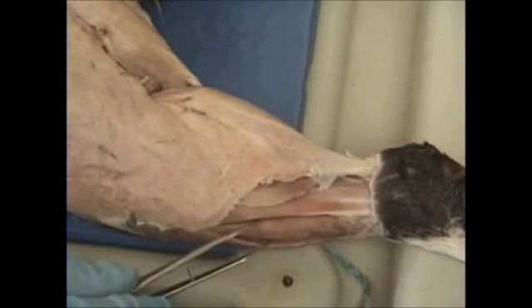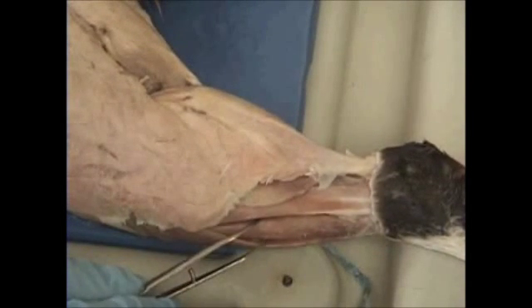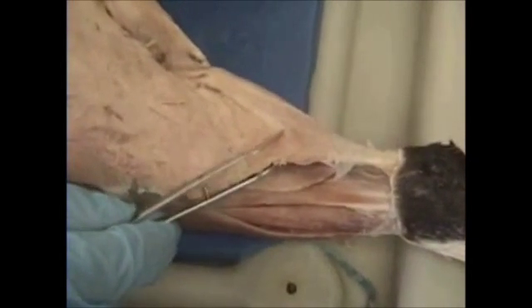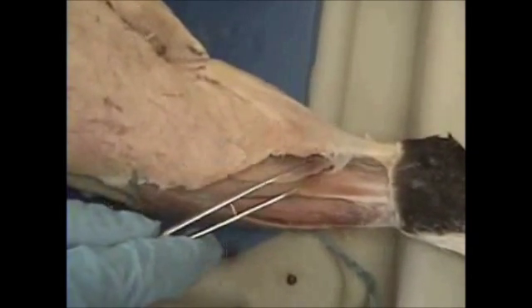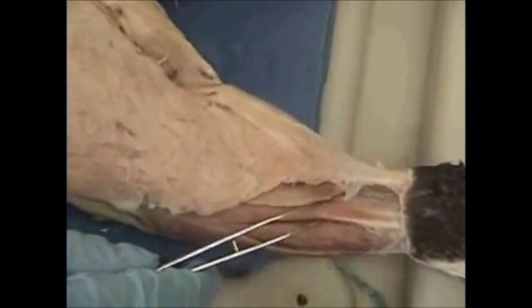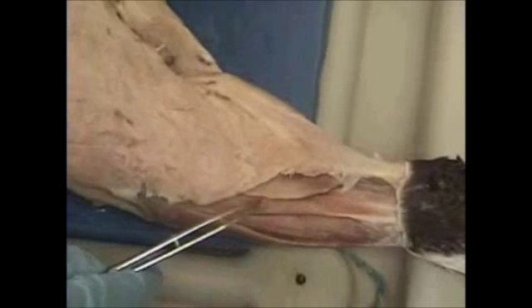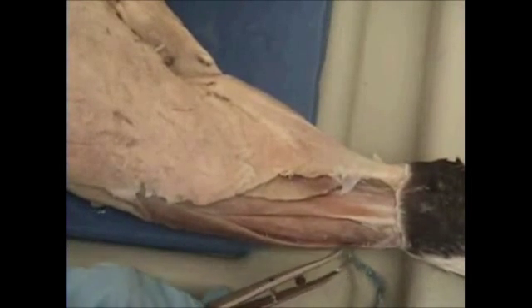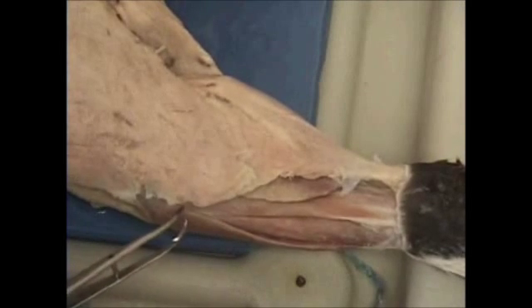Peroneus muscle. Extensor digitorum longus. And here we have our tibialis anterior muscle. So to review: gastrocnemius, soleus, peroneus, extensor digitorum longus, and tibialis anterior.